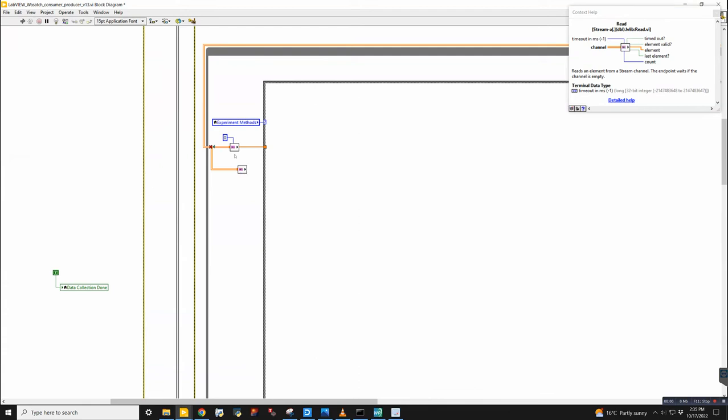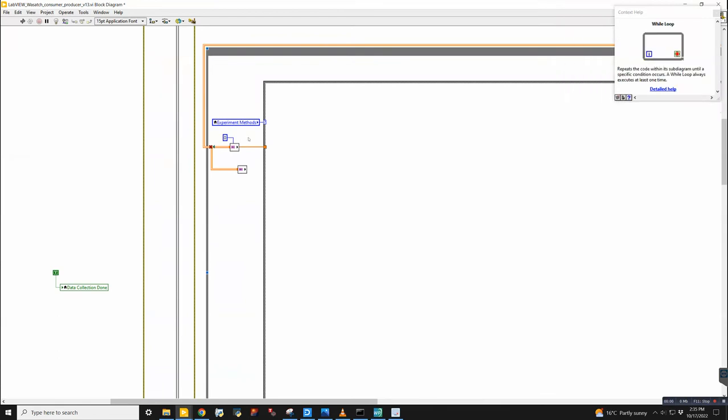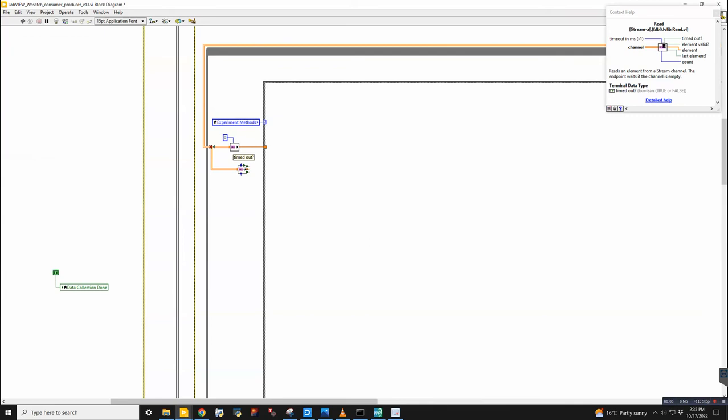So I will set this to 0 usually, which means that if this loop runs and there's no data there, then it will just go and loop again. It will do that until it has some data passed to it. And once it determines there's some data, then it will do something. You can pass out a Boolean that says, did this time out? One that says, do I have a valid element coming out of here? And this one down here, last element, tells you if you're at the last data element in your queue.